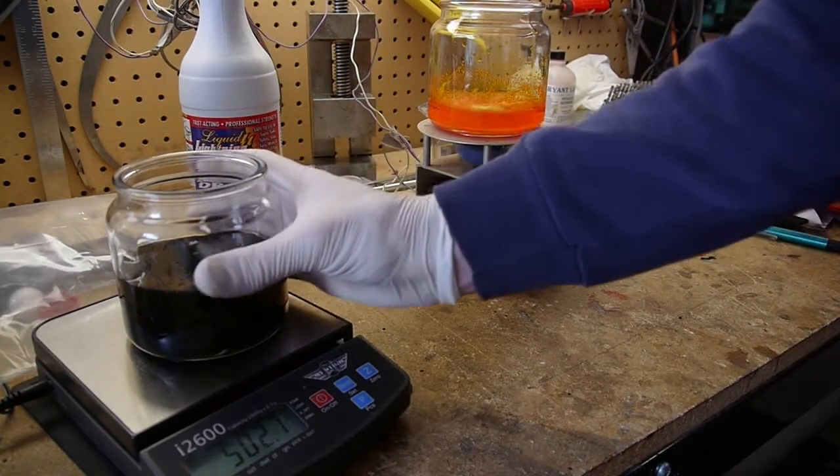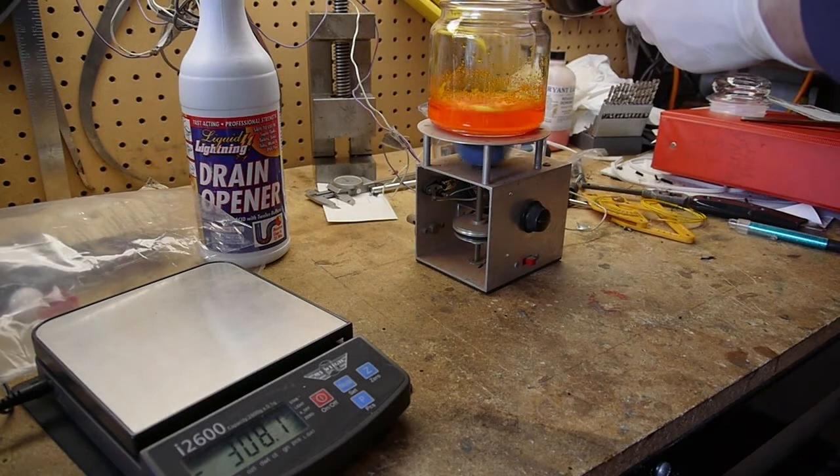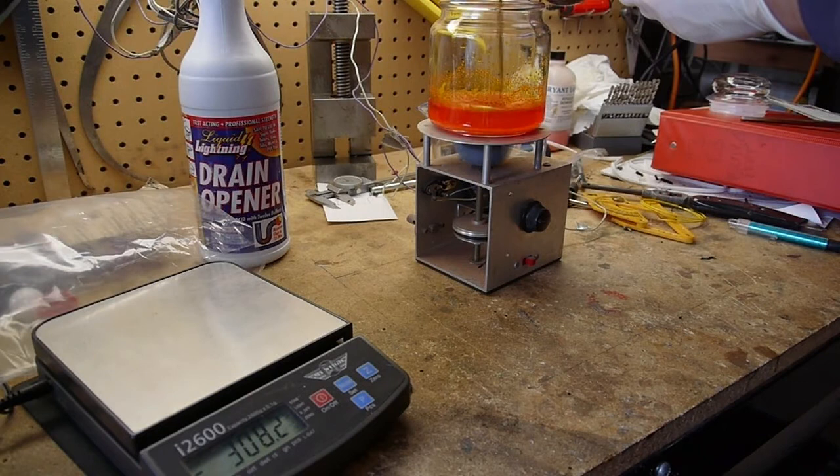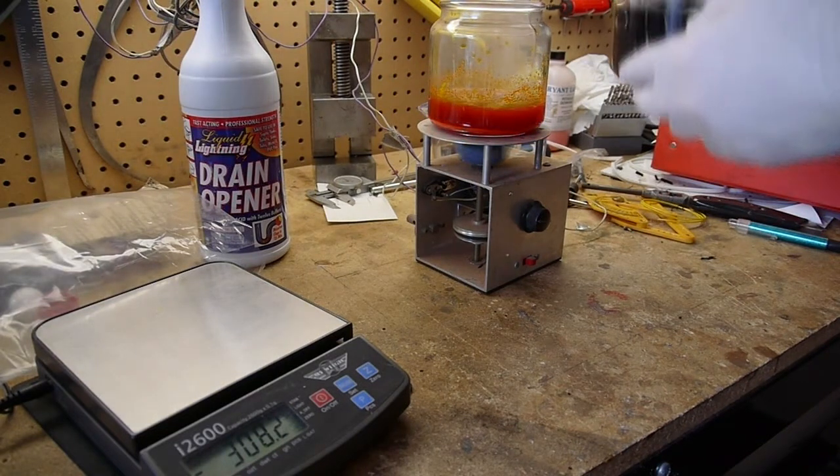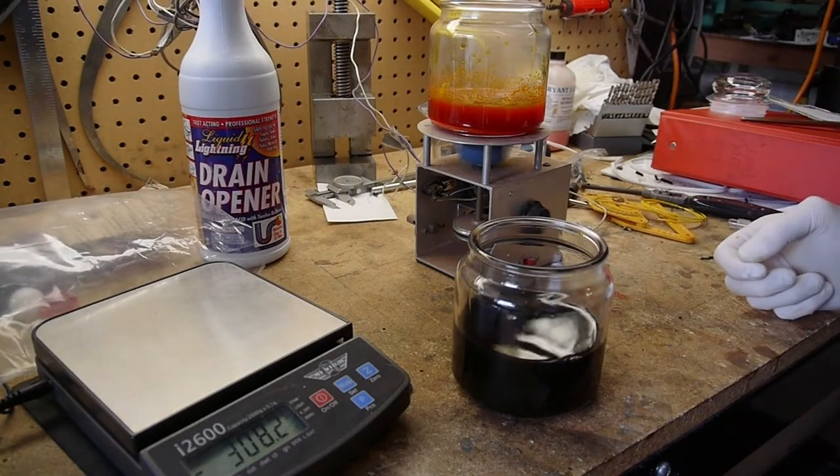Alright, I'm going to start adding the sulfuric here. And it's going to release a lot of heat of course. So you've got to add it slowly.